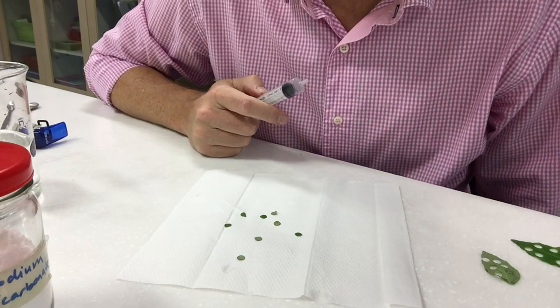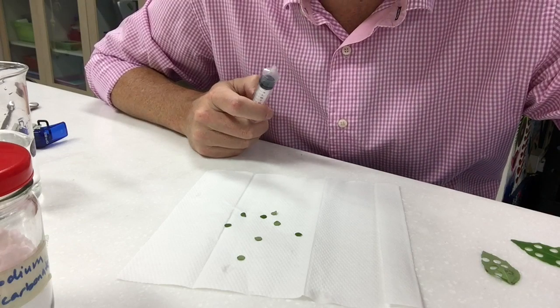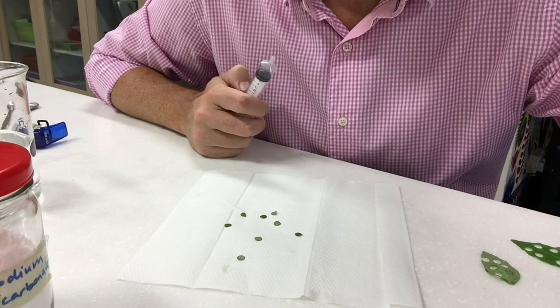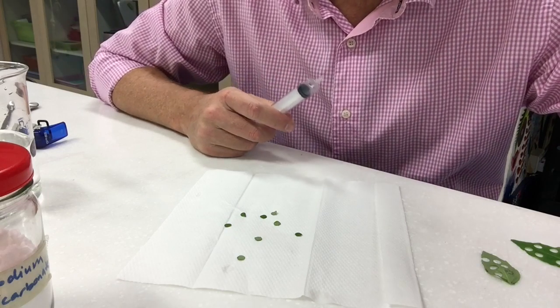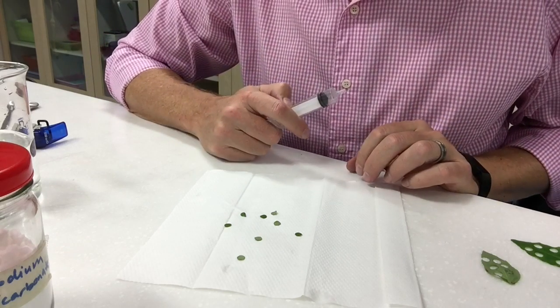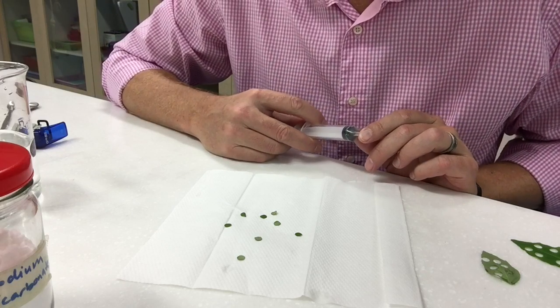Okay, I'm going to show you what you're going to be doing for your photosynthesis lab. Again, we might have time to try this in class during next class just to test it out, but then you're going to be designing an experiment to investigate the effects of some sort of abiotic factor on photosynthesis.